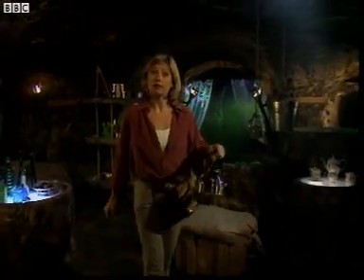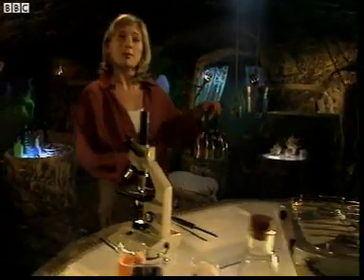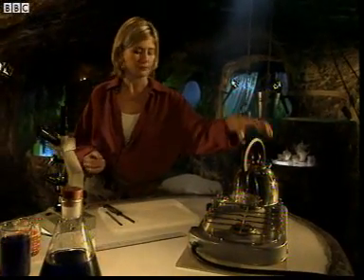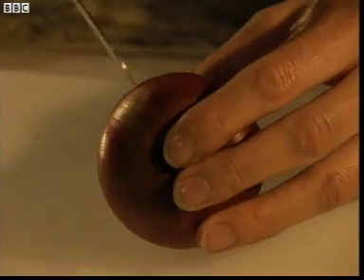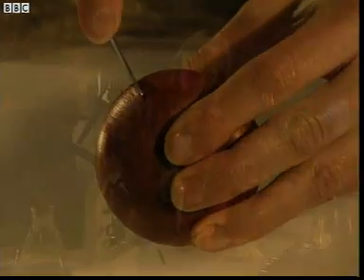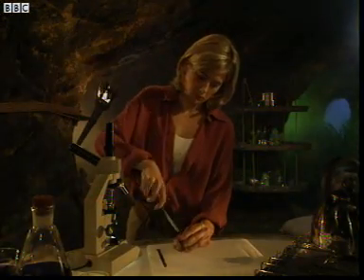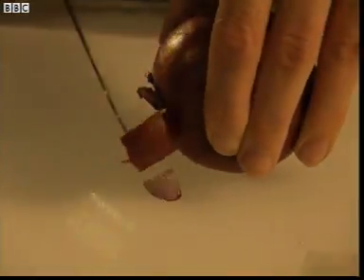If you look closely enough, you can see them. They're like the building blocks of life. Some cells, like the ones in this red onion, for example, can be seen under an ordinary microscope.